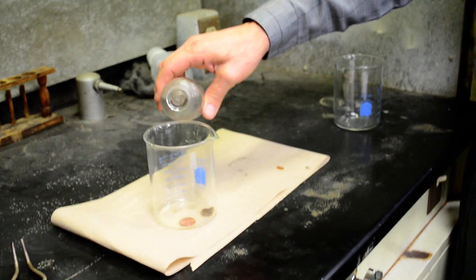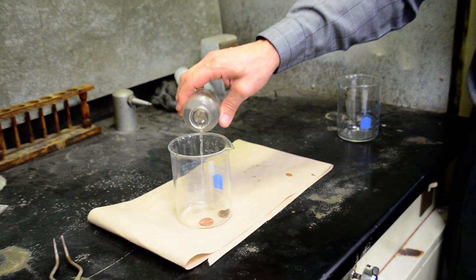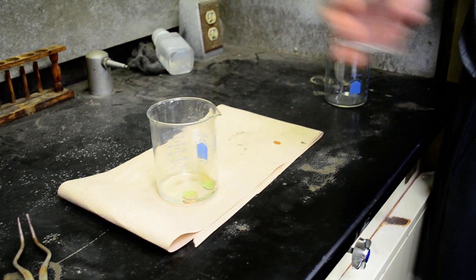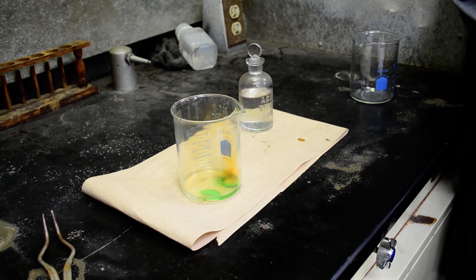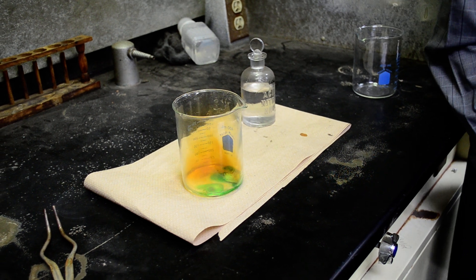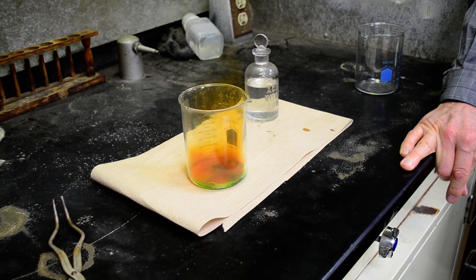Boom, good stuff. Are you ready for this folks? Here it is. Wow, did you see that really shiny penny went first? But the other penny is reacting more quickly. There we go.